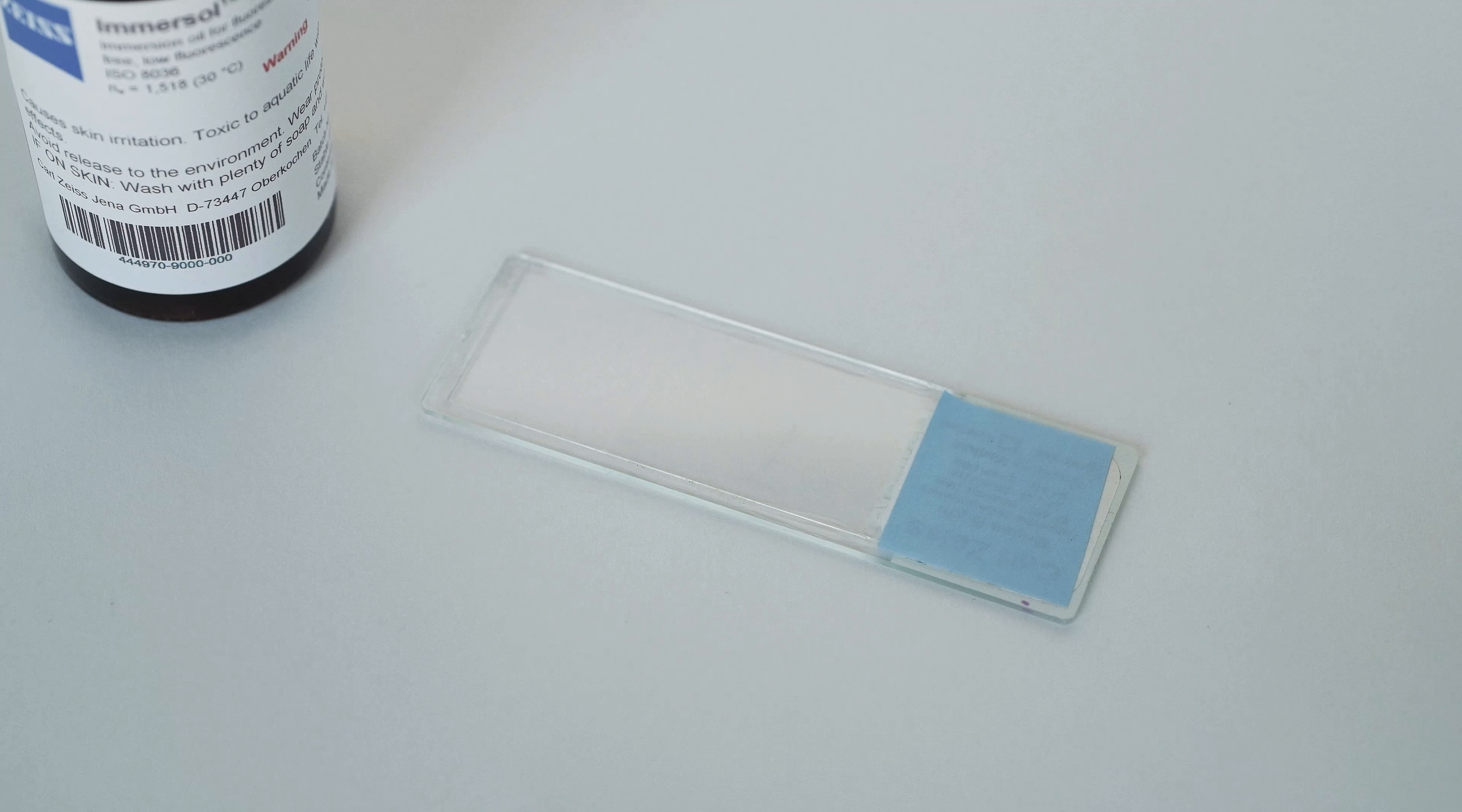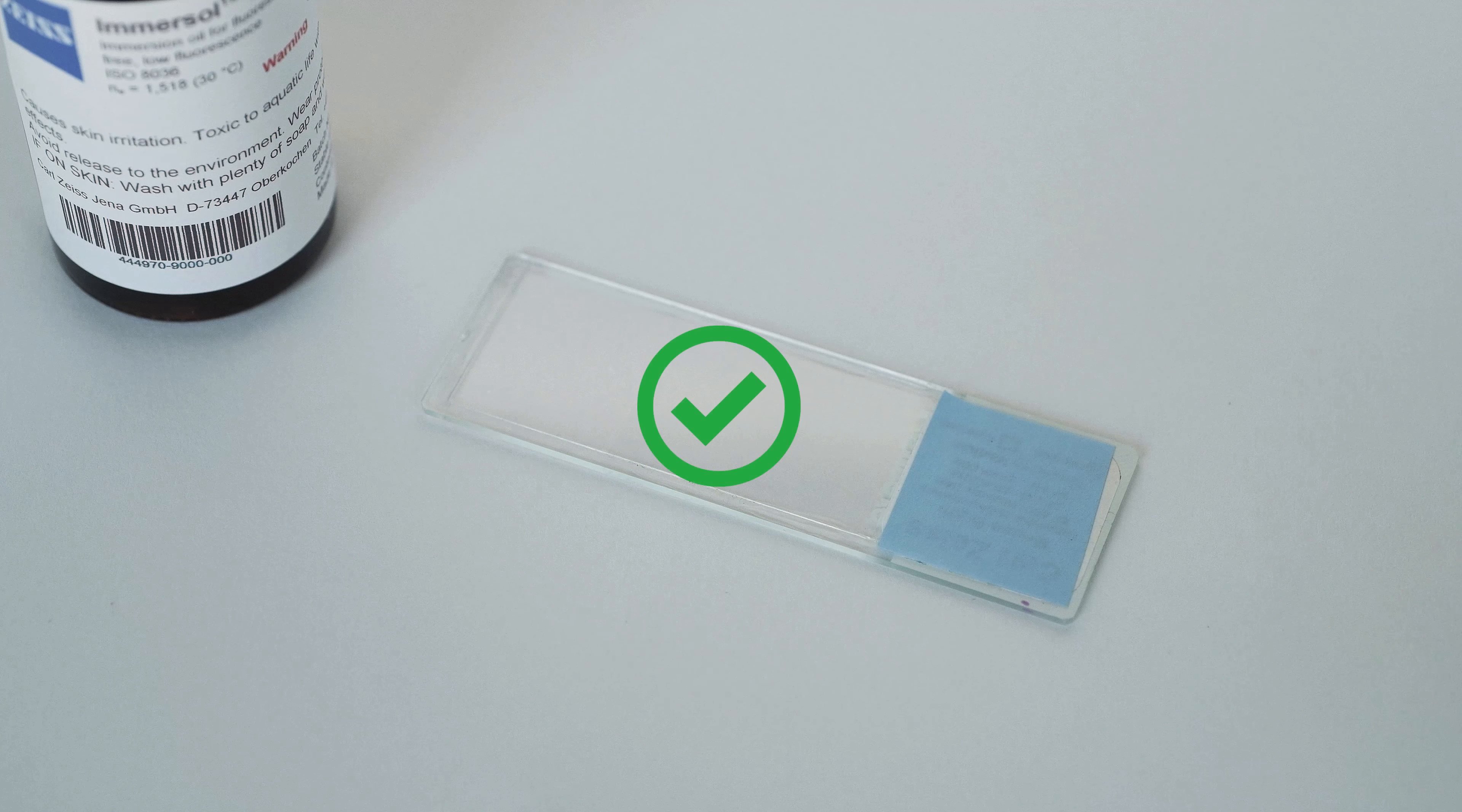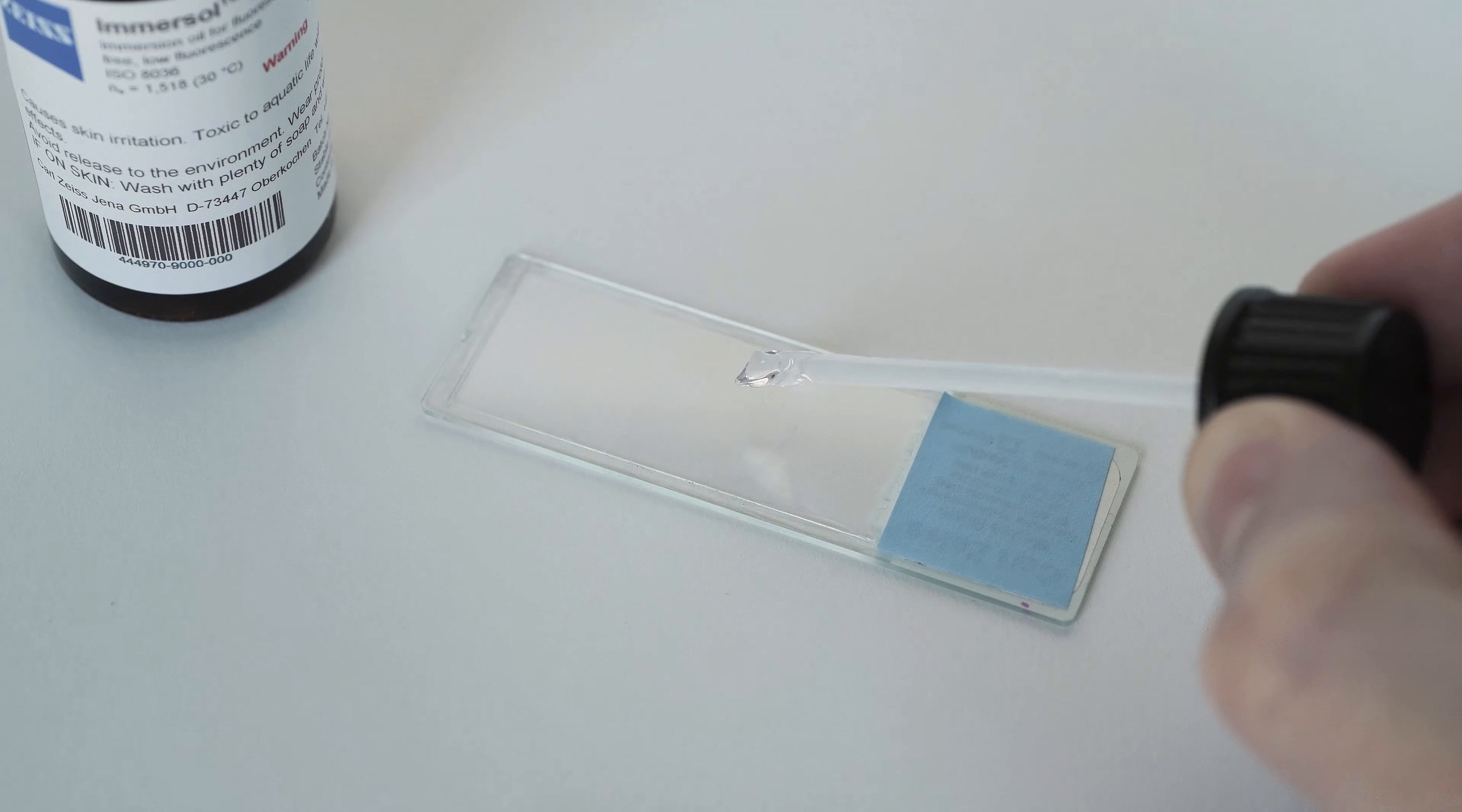Please be very careful to not get this solution on the outside of the bottle, or on your hands, tables, or anywhere else other than your coverslip. Immersion fluid is a category 2 skin irritant, so please be very careful. Touch the bead of oil to the cover slip and then quickly remove the applicator.